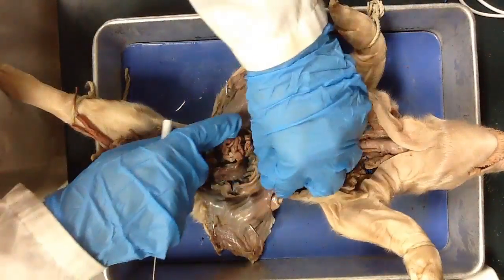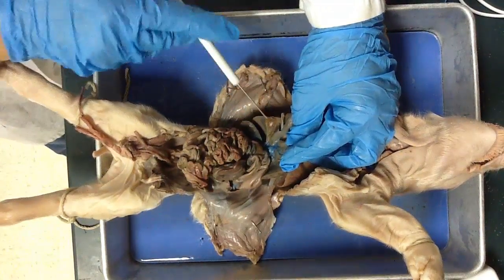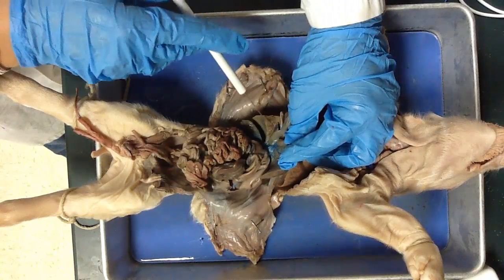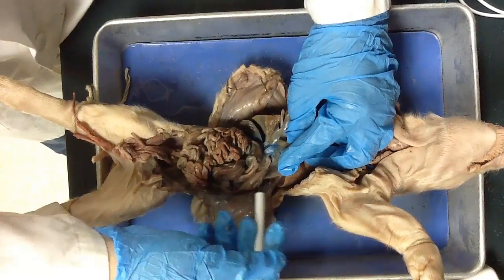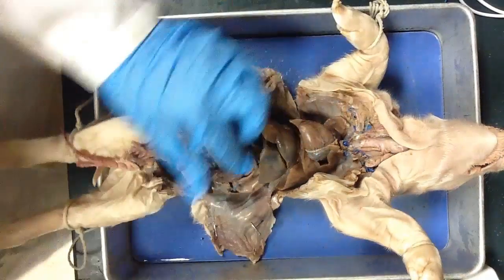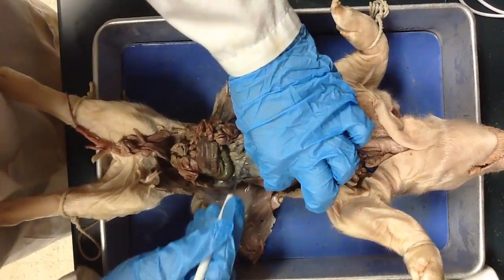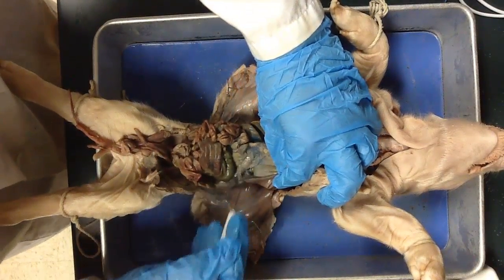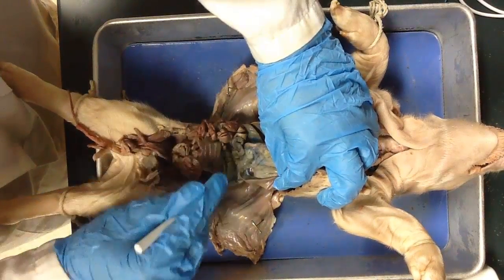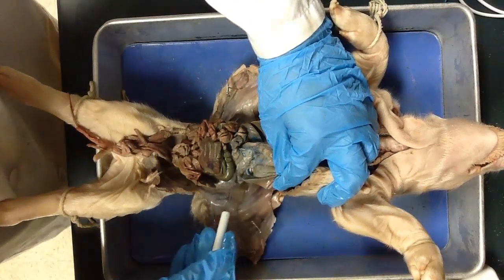The gallbladder — to find the gallbladder, you have to lift up this lobe of the liver and look for this thing that looks like a teardrop. Sometimes it's a much darker green. Here's a teardrop, and then there's a duct coming out of it — a duct is just a tube. That's the common bile duct. Finally, the pancreas. That's probably the trickiest one to find. You need to lift up the stomach, lift up the spleen, and pick away with your probe to find this thing that looks like a bag of cottage cheese, because it is a gland, and glands look like a bag of cottage cheese most of the time. This right here is the pancreas.